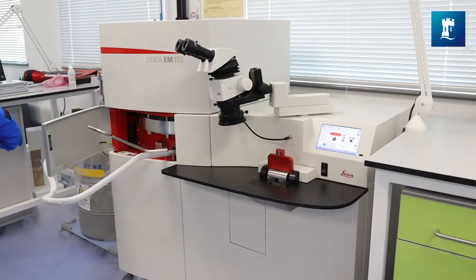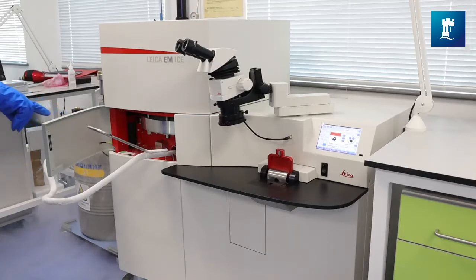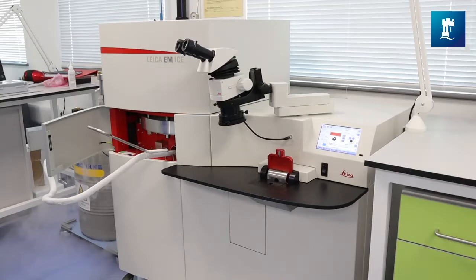Then we have a stereo microscope which you can use to examine your samples, make sure you've actually transferred your samples into the planchettes and that you've got the correct volume present. There's a touch screen which gives you information about the system. There's also a loading station. The surface of this loading station is dark. That's to enable you to see the samples properly and I am quite precious about keeping this so I have a sign on it at all times when it's not in use to say do not leave things on this surface. Underneath that there's a door and inside there is where the samples are deposited into a sample storage dewar, again under liquid nitrogen, and they will stay there until you want to transfer them.